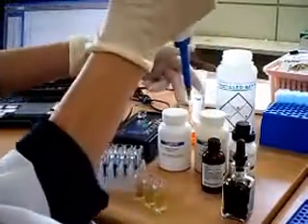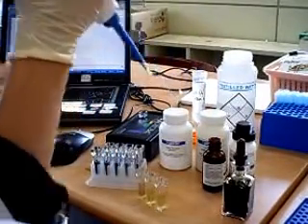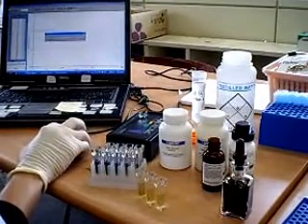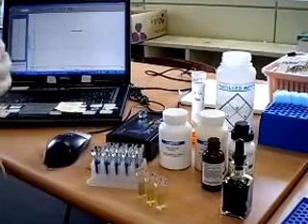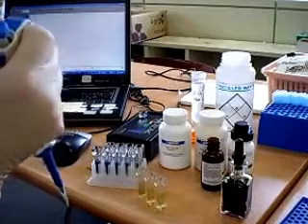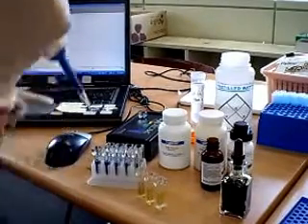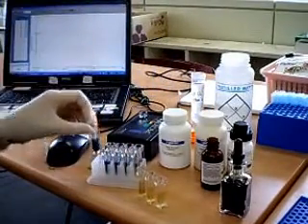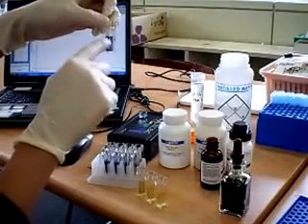You can use different enzymes from different sources. I'm going to start my data collection now. I got my absorbance before I add my enzyme. So when I add my enzyme in, there will be a decrease in absorbance because the blue-black coloration will fade over time.